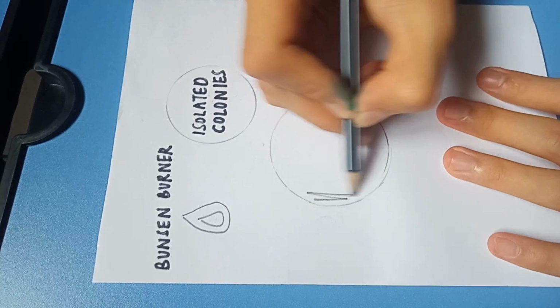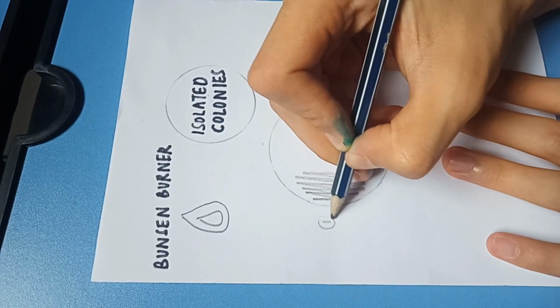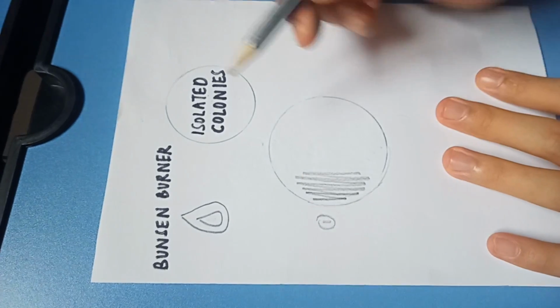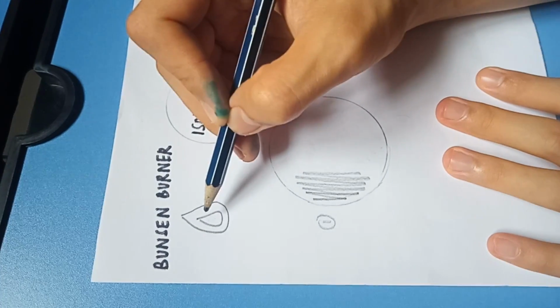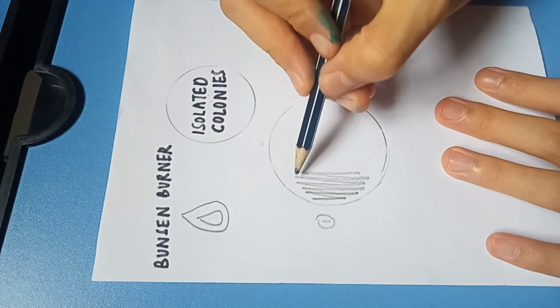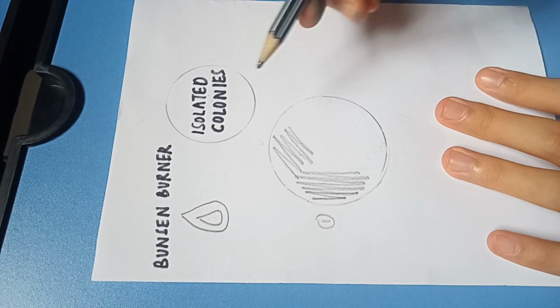The inoculating loop or needle is streaked over an agar surface. On the initial region of the streak, many microorganisms are deposited, resulting in confluent growth of microorganisms over the entire surface of the agar medium. The loop is heated again between streaking different sections. This will dilute out the sample that was placed in the initial region of the agar surface. Thus, fewer microorganisms are deposited as streaking progresses.